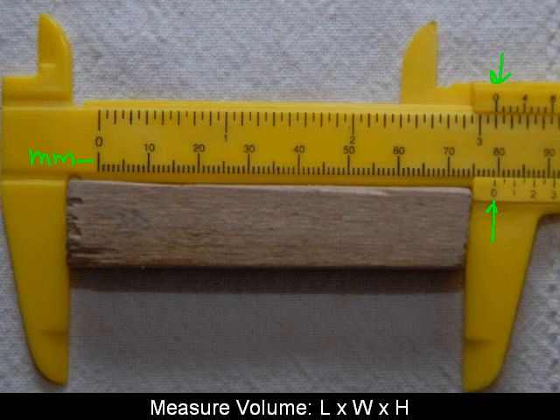That's in inches. But ultimately we want centimeters, because we're going to have centimeter times centimeter times centimeter is cubic centimeters. And we know that 1 milliliter is the same thing as a cubic centimeter. So we can easily convert to milliliters if we use centimeters. So try not to get confused here. We'll measure the length in millimeters, then divide that by 10 to get it in centimeters, and record that. And so we can see here that we have right beneath 80 millimeters, right around 79 millimeters, which would be 7.9 centimeters. But we can be a little more accurate than just saying 7.9.